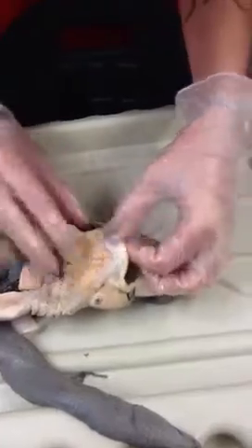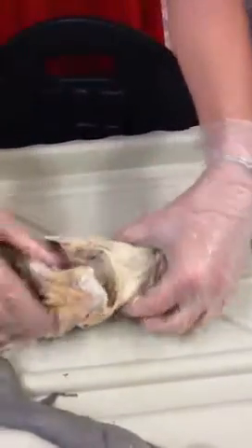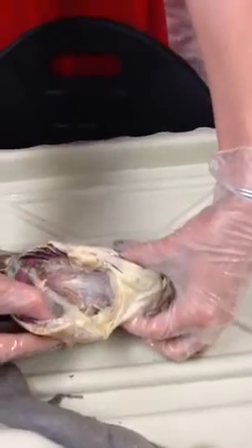We also have our spiracle somewhere that I seem to have lost. Oh, there's one right there, and then right there. So that indentation is going to be your spiracle. Ta-da! Beautiful. And your duodenal or whatever.